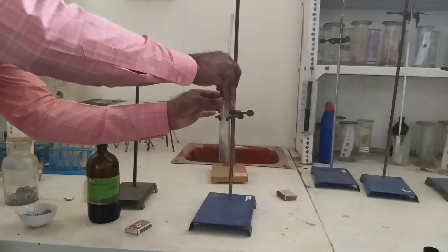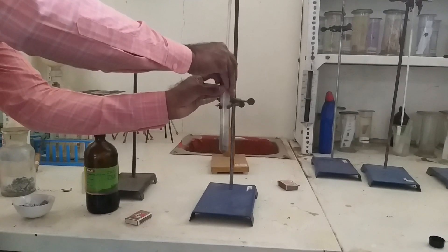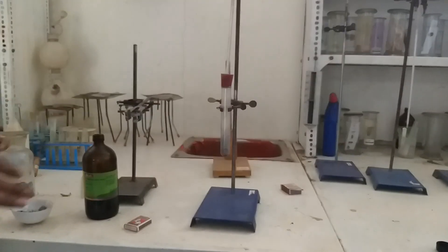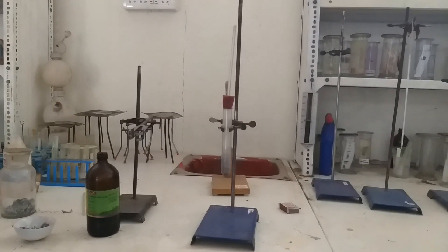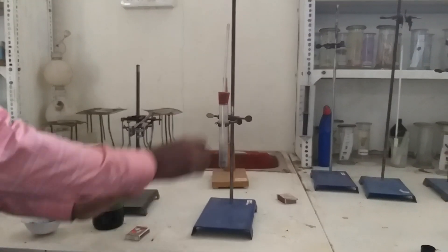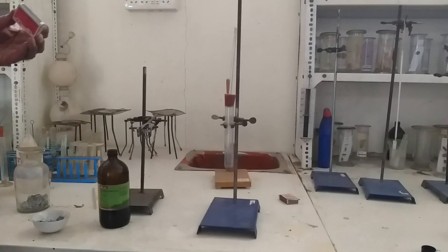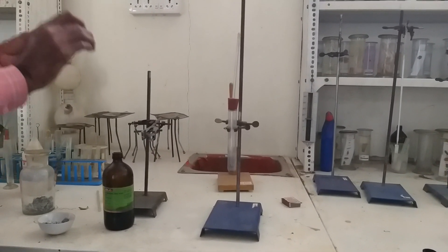And now we have to use this tube through which we pass the gas. Fit it tightly. And now identify which gas this is.